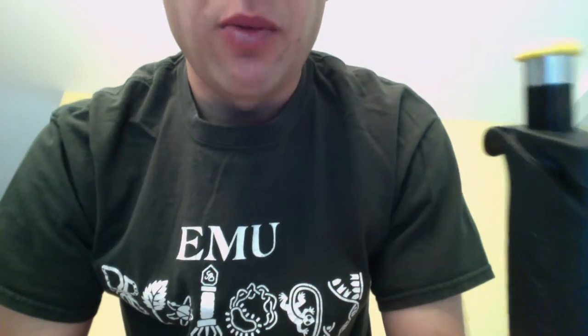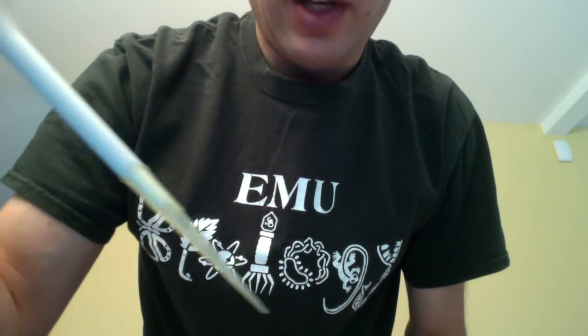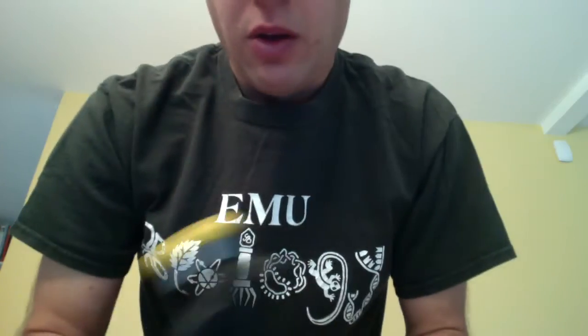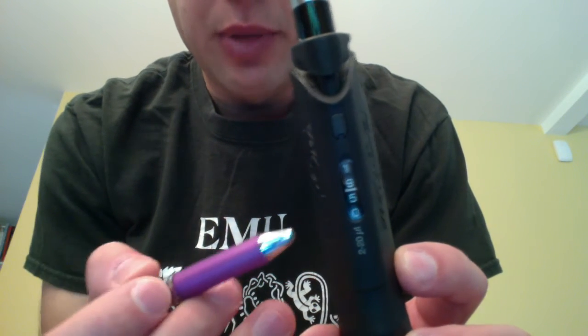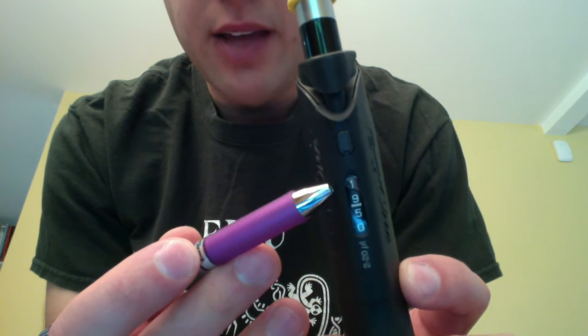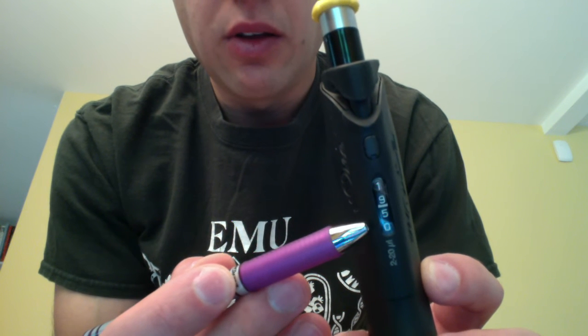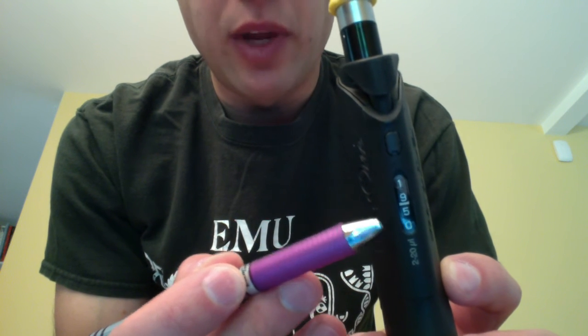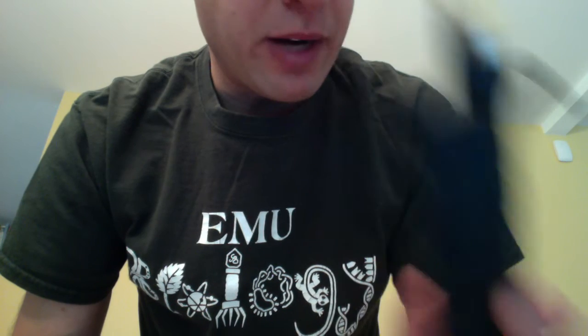This here with the yellow button is the P20, the 20 microliter micropipette. It's meant to use these yellow tips. Again, it has four digits in the display. The top digit is tens, next digit is ones, then tenths, and hundredths. You can see there's a line between the ones and the tenths, again to distinguish between whole and fractional microliters.